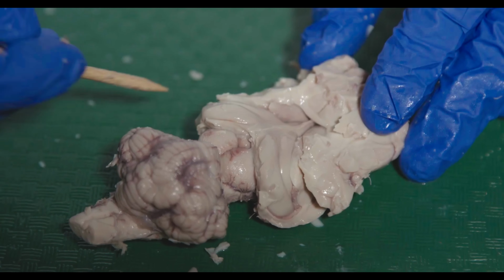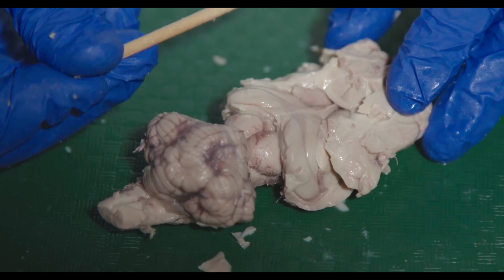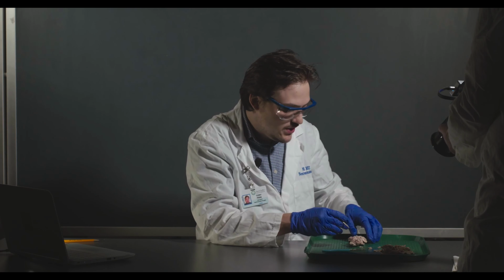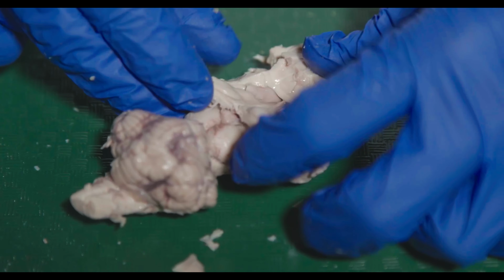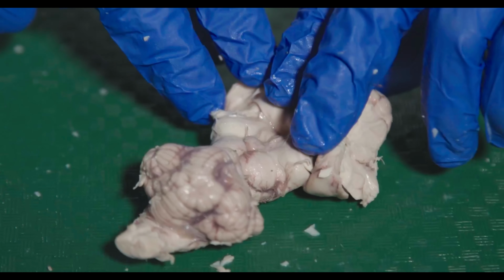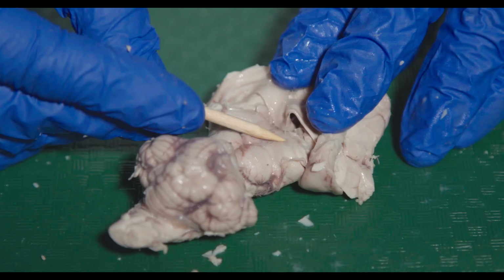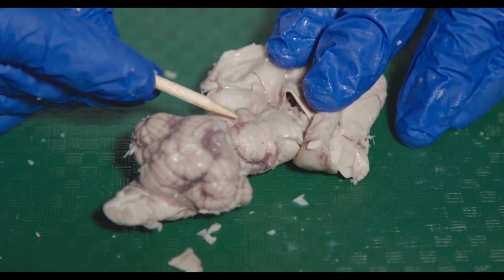So what I'm going to do now is essentially peel the hippocampus this way and show you the thalamus underneath. So in the lab manual, you will essentially see plate 6. That's what I'm going to do now. So I'm going to pull this up. So I'm pulling the hippocampus up. All right. And then these two bumps here are the thalamus. And again, here's the pineal gland and the superior colliculi.